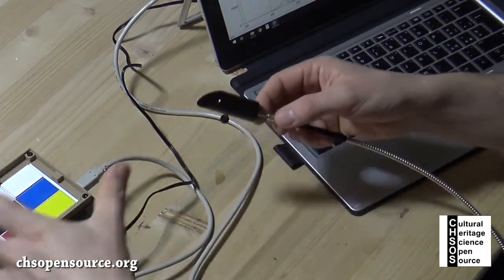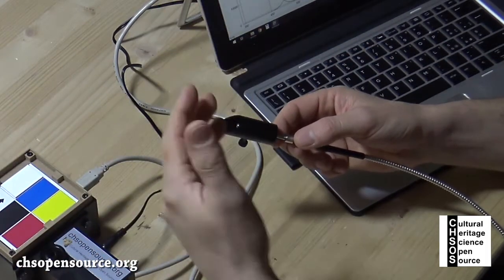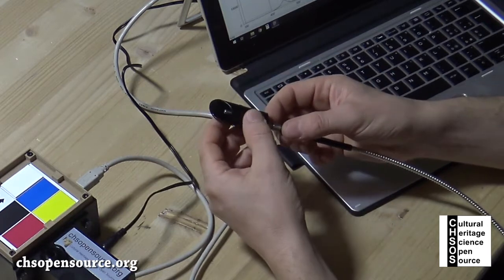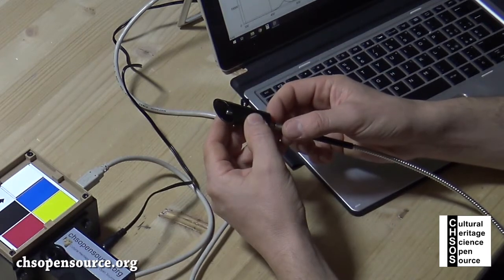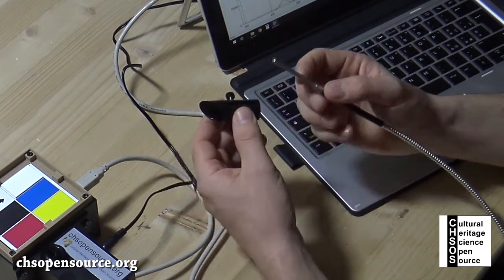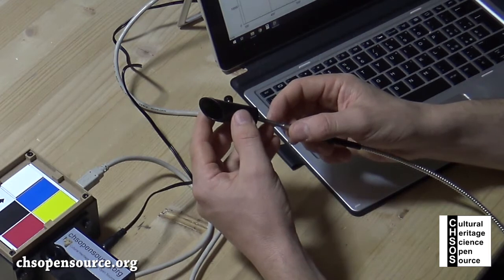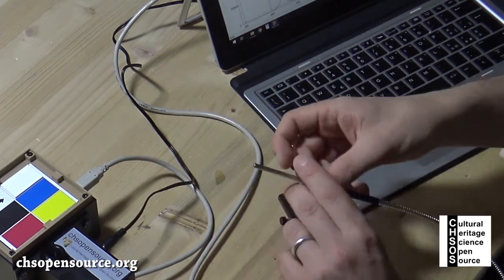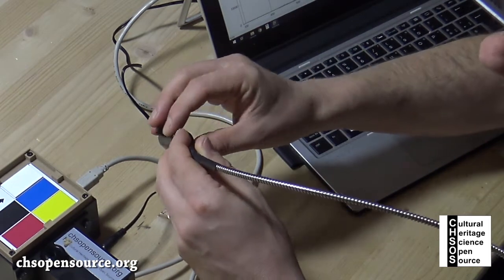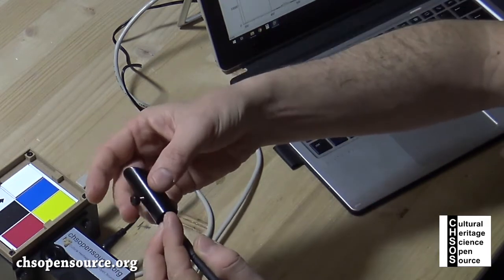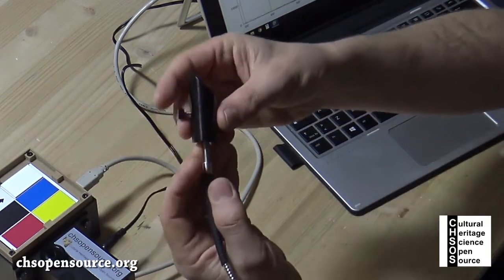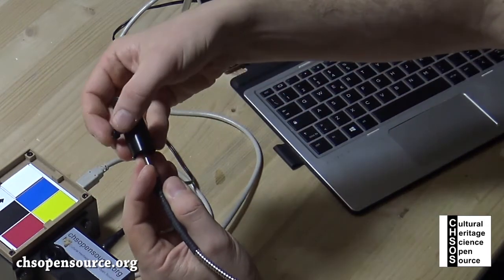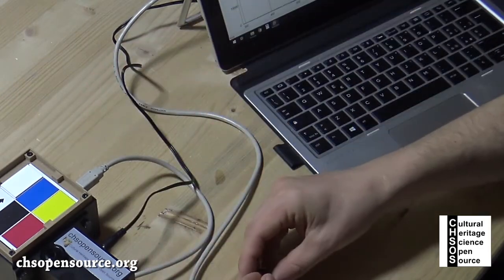We need to click here 'run'. Something is happening here in the x-axis. We have already a curve, so the system is probably working. Actually we need to remove the cap from the probe. We see it's working.